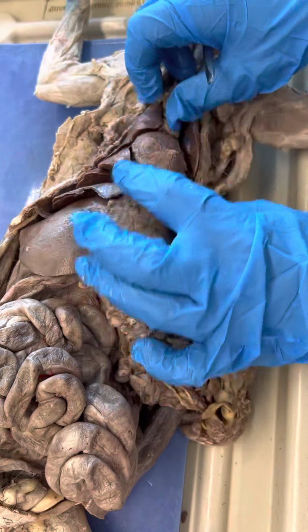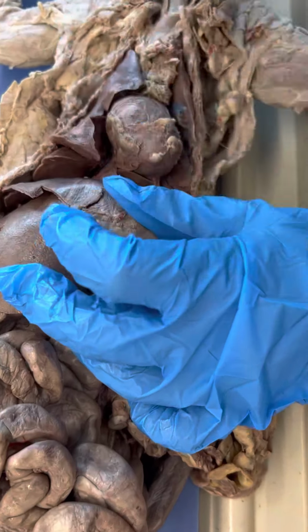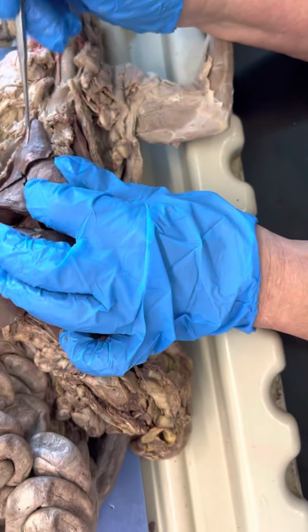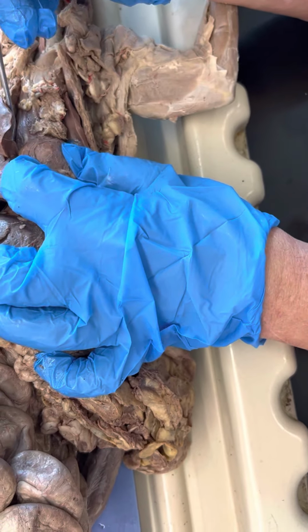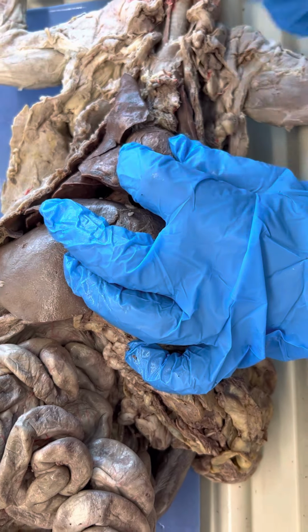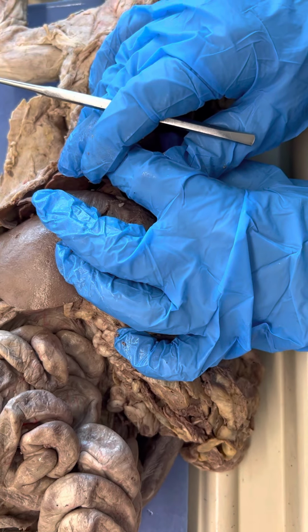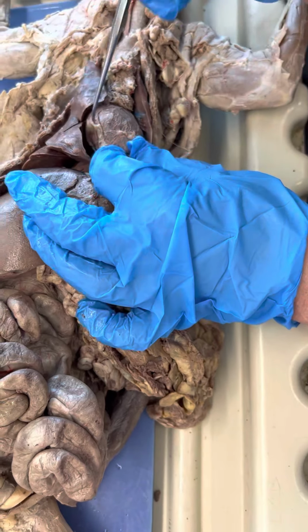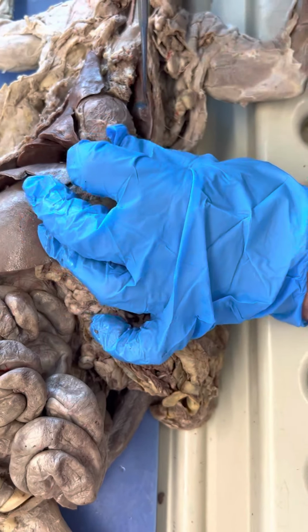Accessory lobes are down in here in the middle. I don't think you can see the primary bronchi on here, but they would be the ones coming off the trachea and going in. I would make sure I could find all those bronchi on the model. Phrenic nerve would be down in here. Again, it would be white. I don't see it on this kit.